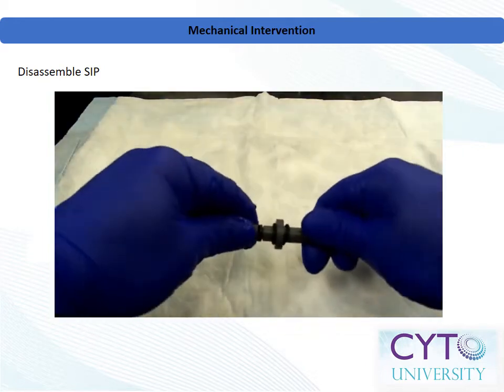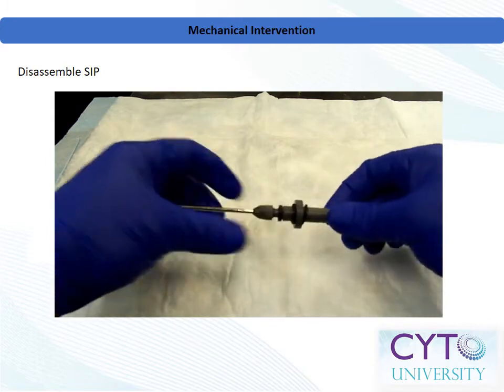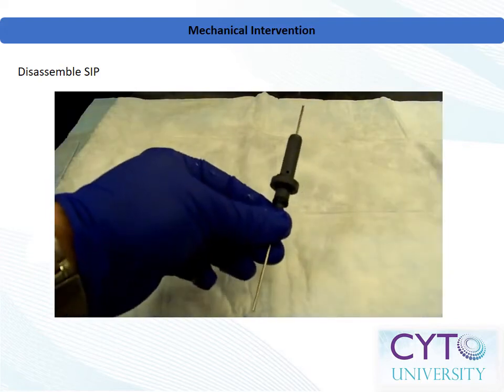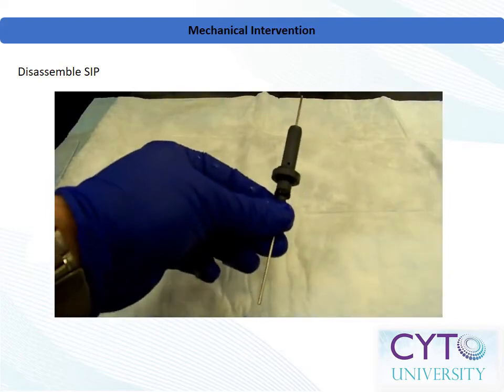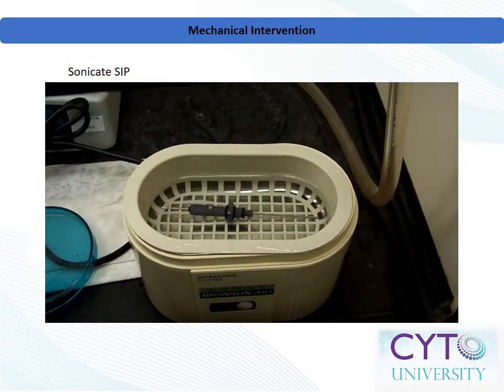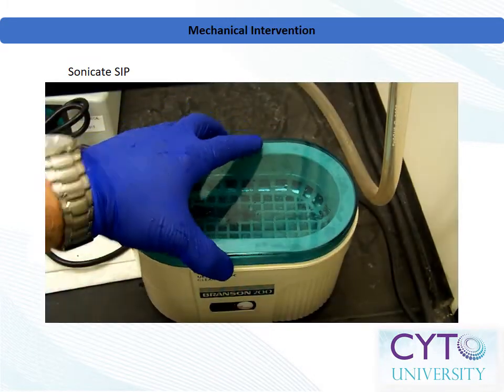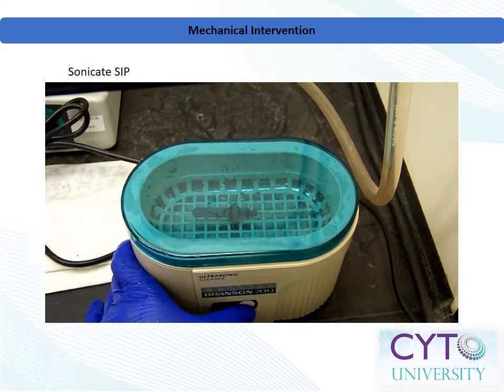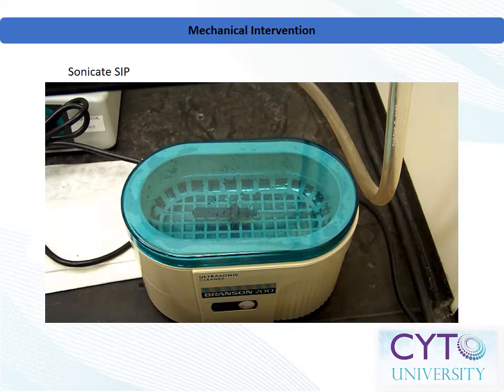With the sample injection apparatus out of the instrument, take special care not to drop or impact the apparatus onto any surface. Remove the outer sample injection port tube by unscrewing the cone. Then gently slide the outer tube off of the inner tube. We will present three options to remove a clog from the sample injection tube, in order from most gentle to least gentle. First, try sonication. Immerse the entire inner sample injection apparatus in a water bath sonicator, and sonicate for 30 seconds or more.